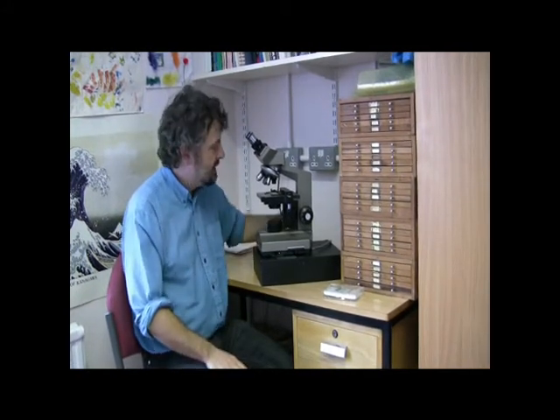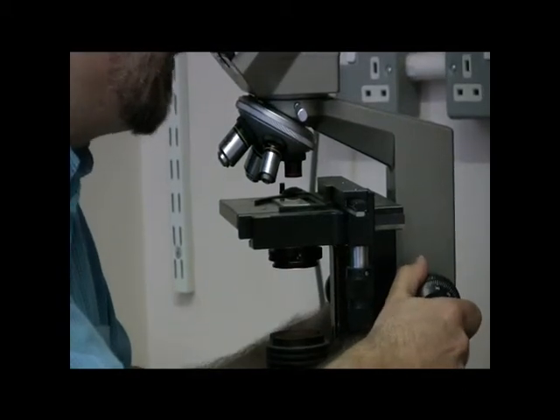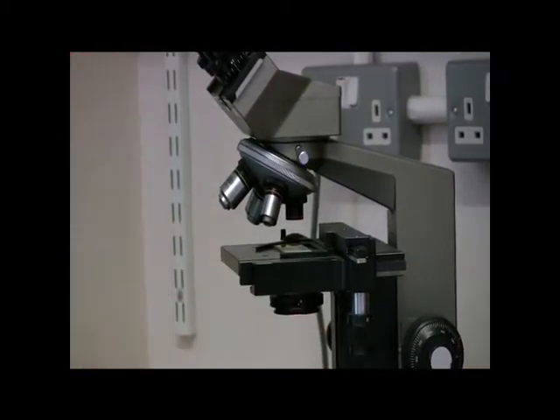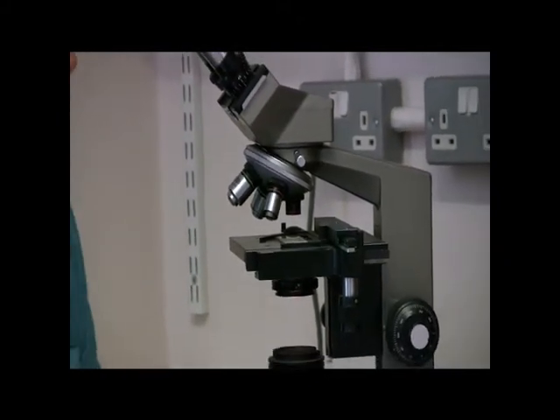When you put a microscope slide under the objective for the first time, you want to be really careful that you don't smash the microscope slide. What I would advise is that before you focus in on it, don't look down the optics but look at the stage and bring the slide up as close to the lens as it will go. Then you can only focus away from it. If I look down now and focus away, the radiolaria come into focus and I haven't risked breaking my slide. That's particularly the case when you're on the bigger objectives, where there's a greater risk of putting your objective through your slide and ruining both your slide and potentially your objective.